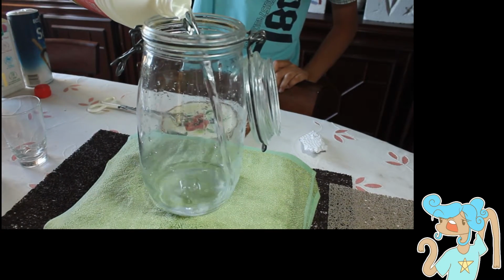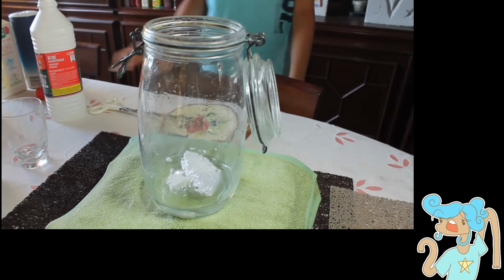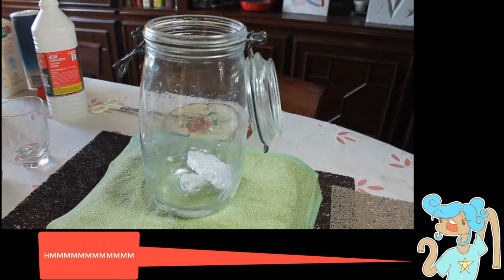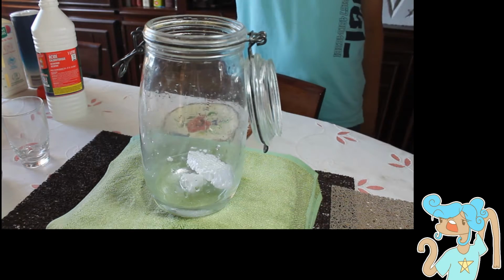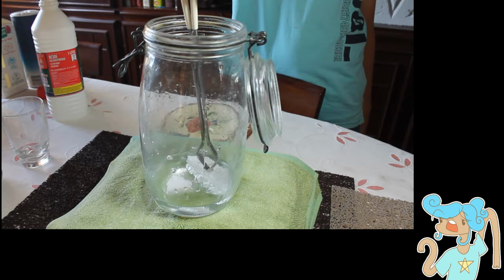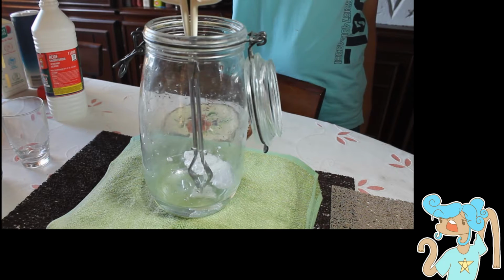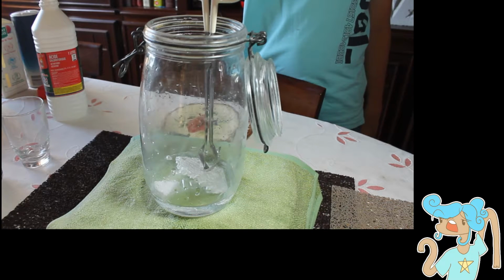The next experiment is with styrofoam. And the styrofoam is in. It floats happily ever after on top. Give it a push. It's been pushed inside the acid, and we have so far no reaction.